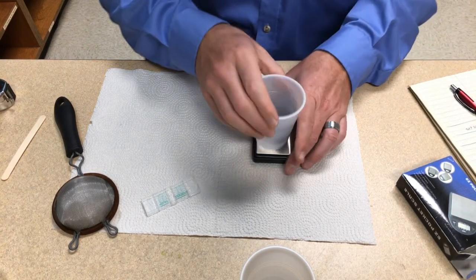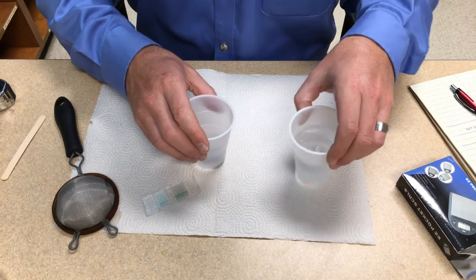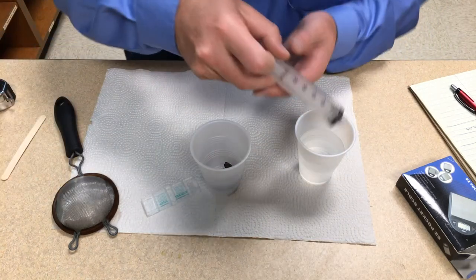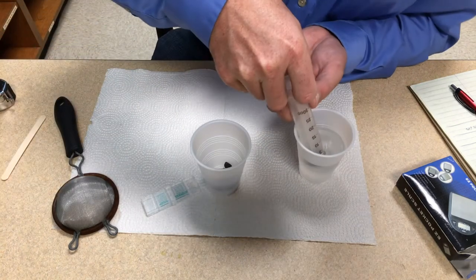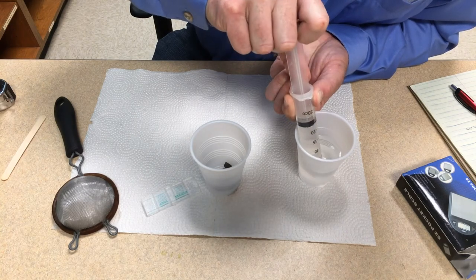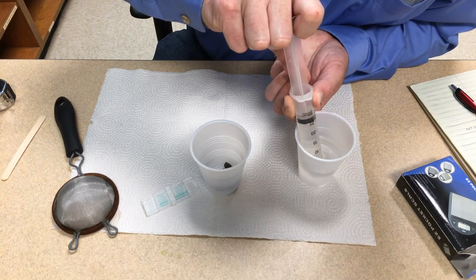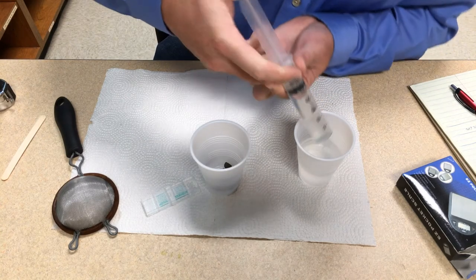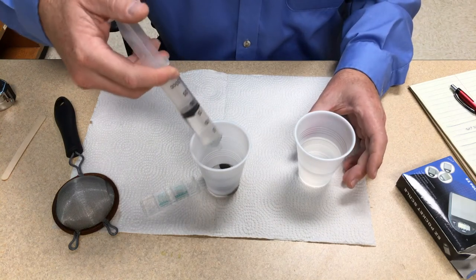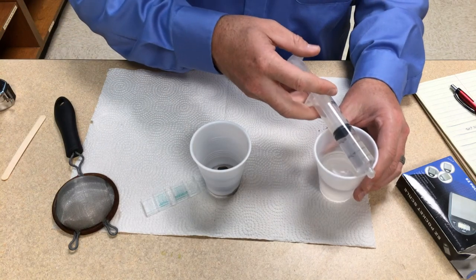With the amount recorded, you're now ready to get it in the solution. Using your syringe, pull up 26 milliliters or 26 cc's of flotation solution. This will all eventually be added to your sample, but I like to start off with just about half of it, just enough to wet the sample.